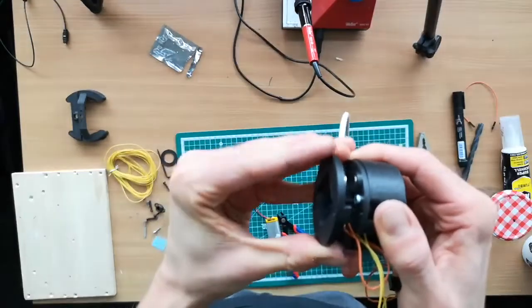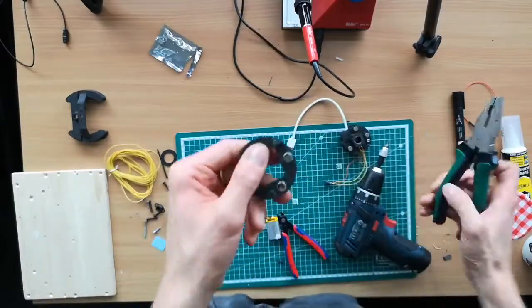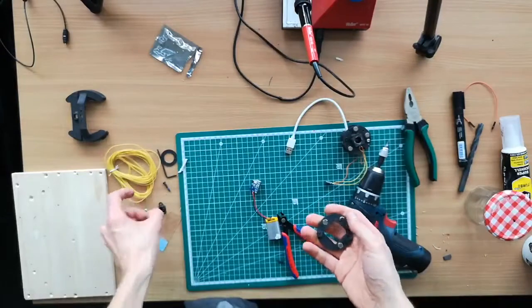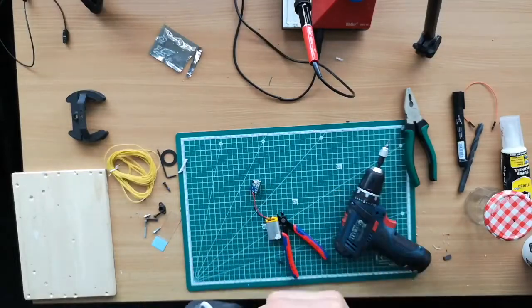So now all the magnets point away from each other. So that's correct. The last bit is to make sure that all the magnets are tightly packed in. And then we can use screws to establish the mechanism, the focusing mechanism.